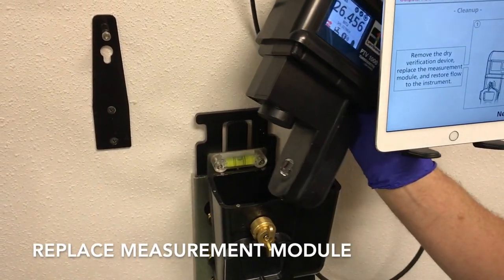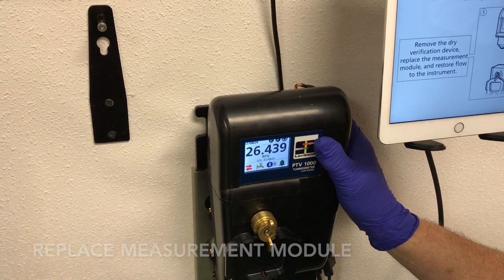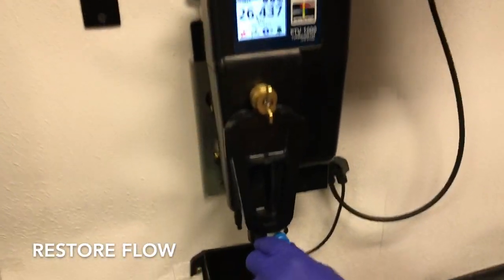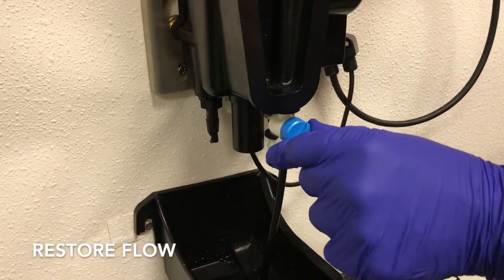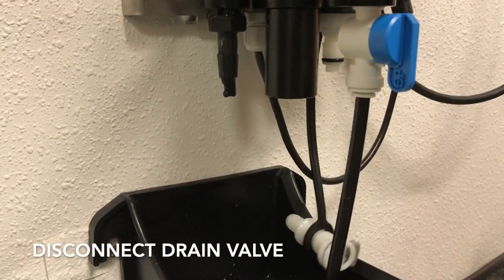Followed by the replacement of the measurement module. Flow is restored to the body and the drain valve is disconnected.